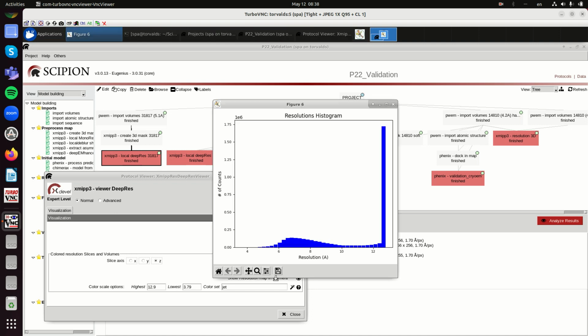So we see that 5.1 is at the extreme of the local resolution distribution. Actually, this is a very general result. The resolution of the FSC is at the extreme of the local resolution histogram. In a cartoon way, we can think of the FSC resolution as the best resolution of the best voxel in the best direction. So it is an indicator of up to where you have gone.